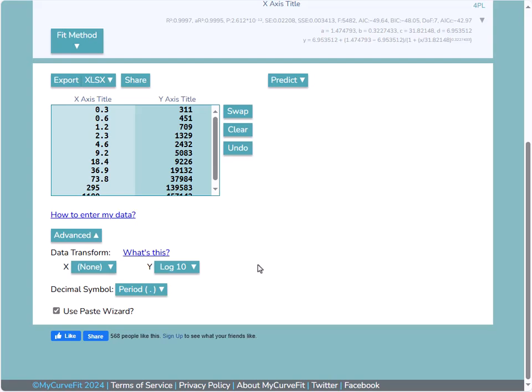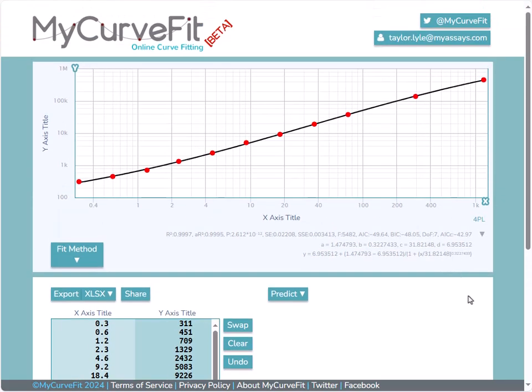Predicted values apply the inverse of the transform. So for example, with the log10 transform selected as we've done here, the curve will be fitted to the transformed data, and any predicted values will apply the inverse of the log10 transform, so no additional calculations are required. And once we've applied that change to our data set, scrolling back up, you can see the curve is much improved and the 4PL fit is applied as expected.